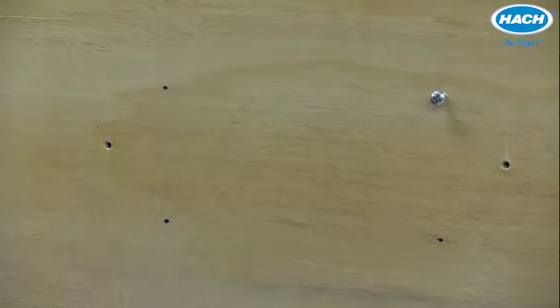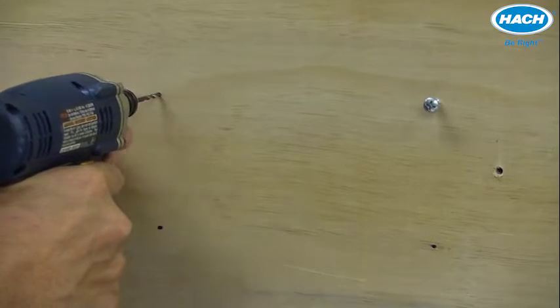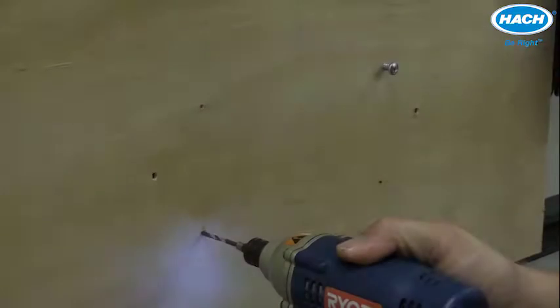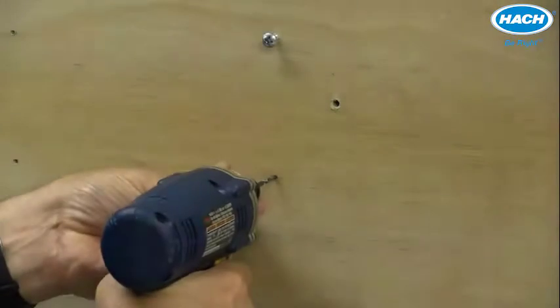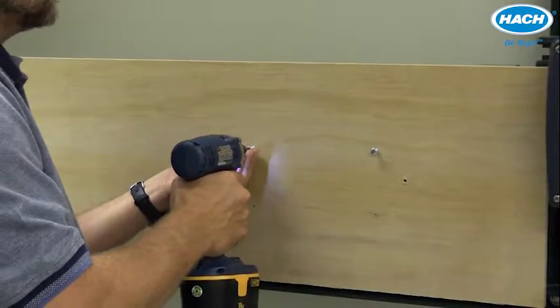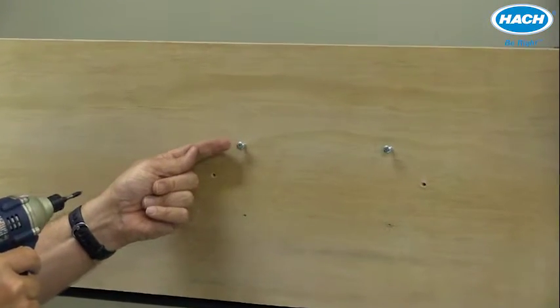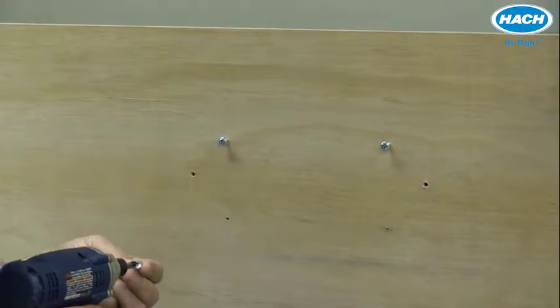Once the position of the four holes have been marked out, they can be drilled with the drill and bit. We can then mount the three remaining screws, being sure to have about eight millimeters of clearance to make sure that the sensor can mount onto the bolts.